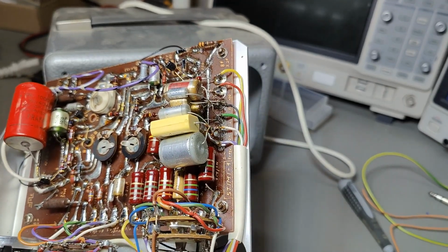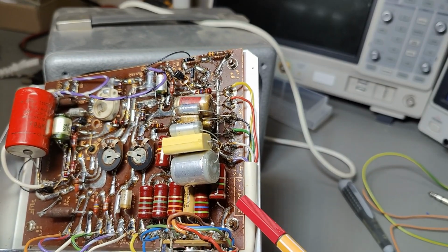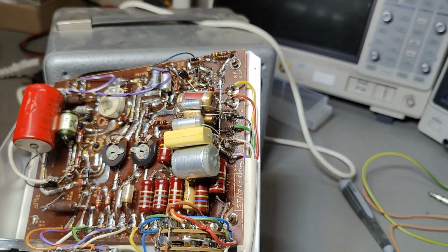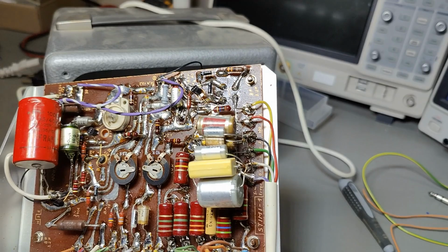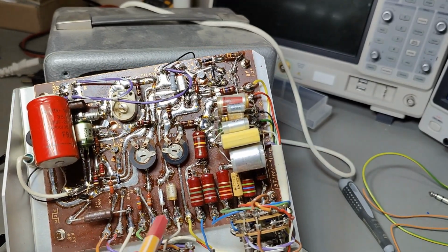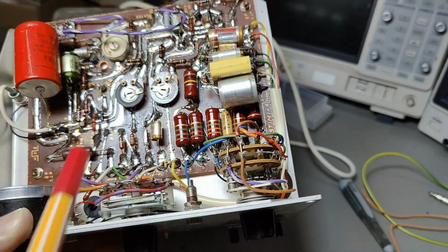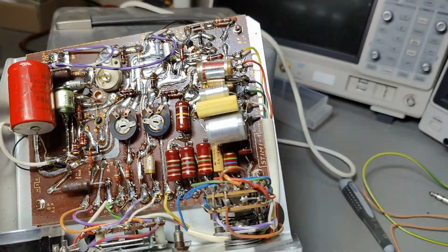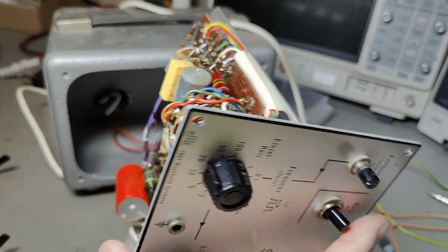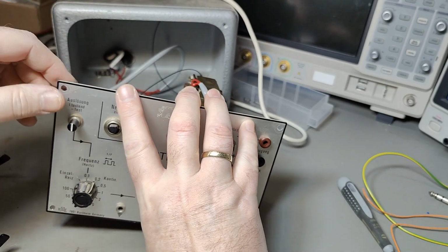You can even read the circuit board here. It says STIMI and then 1. So there's probably also a number 2 or something like that. So this is the first STIMI. And yeah, we also got a little bit of handwriting here on the different signals that go to the different switches. But I think I'm ready to power this up. I don't see anything that should prevent me from powering this up. So let's see if it works in any possible way.